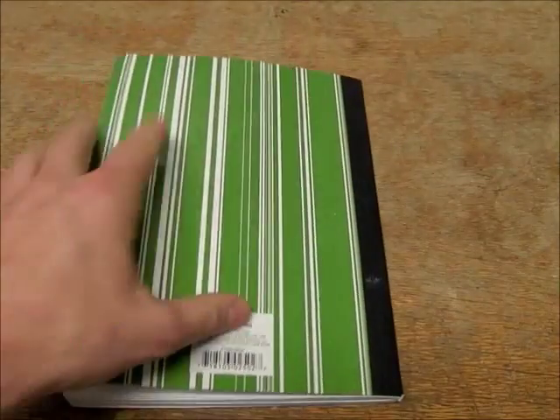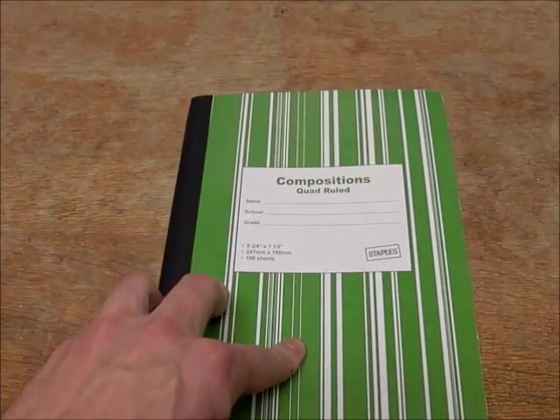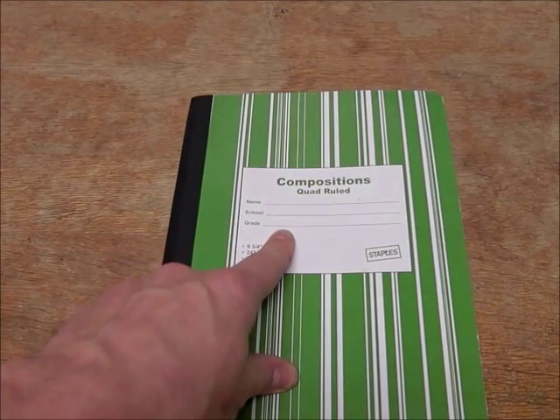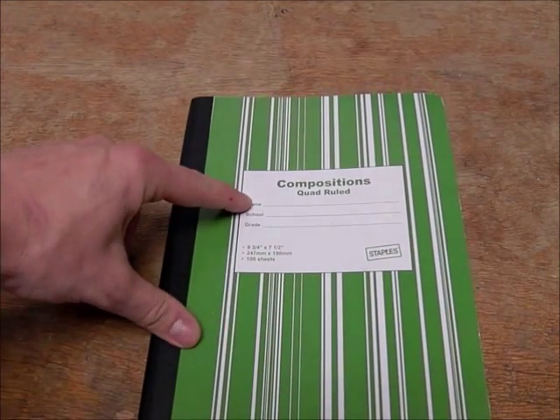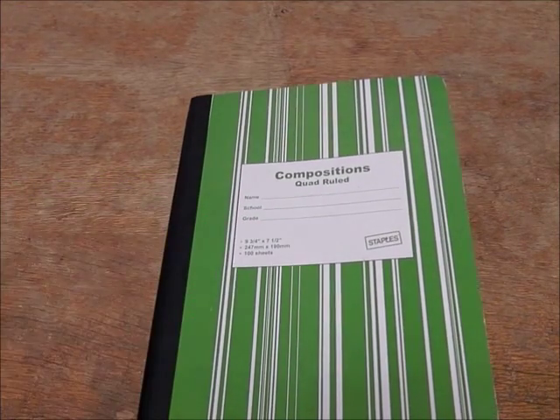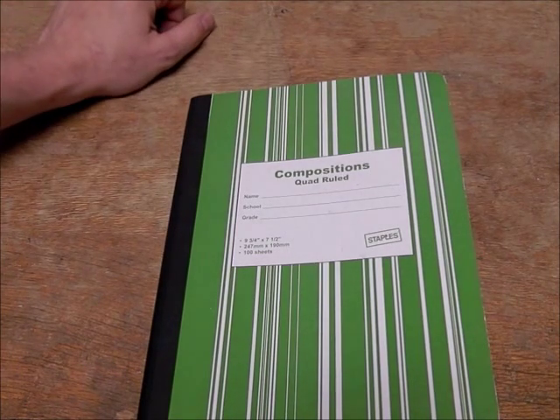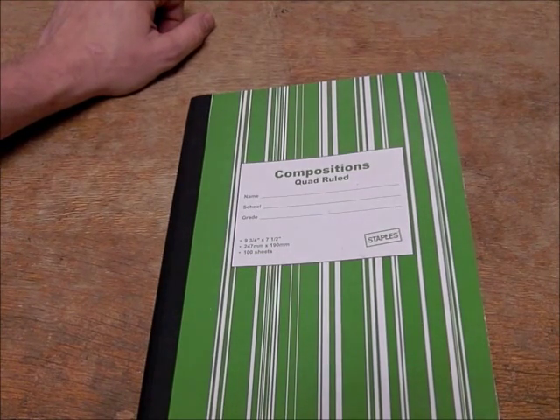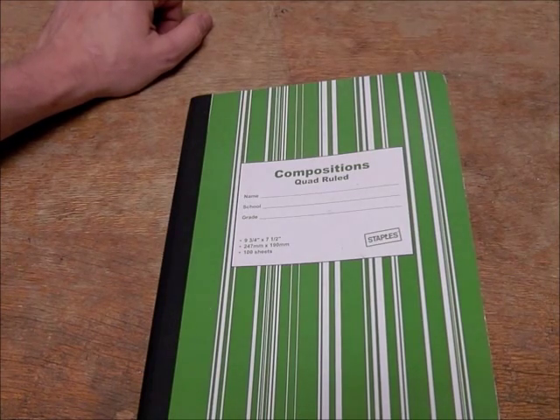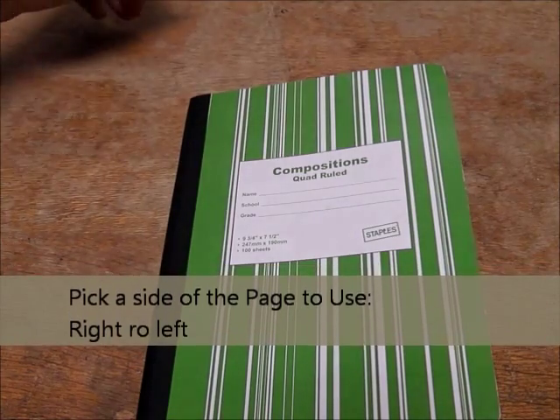Now that we have that set up, if you flip to the front of the actual page itself on the cover, it would make sense to put down your name. It also makes sense to put down the name of your teacher and the class period that you have them. Full name on the cover should be put in ink, because if it's not in ink, if it gets lost and it's in pencil, it might just rub off too easily.